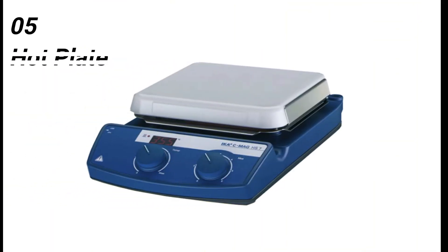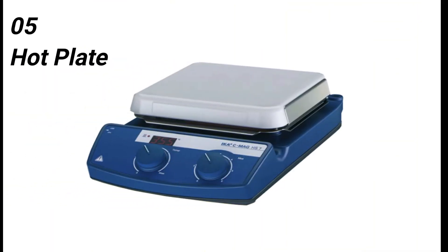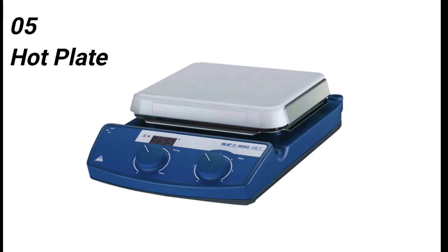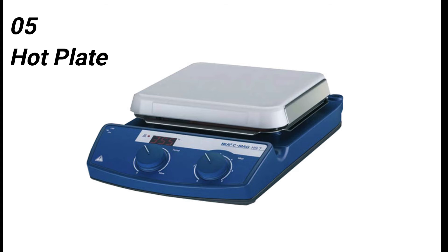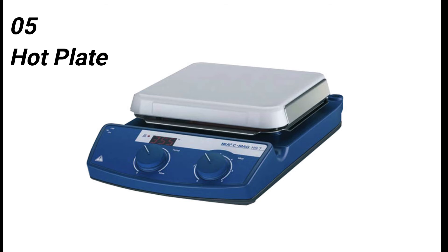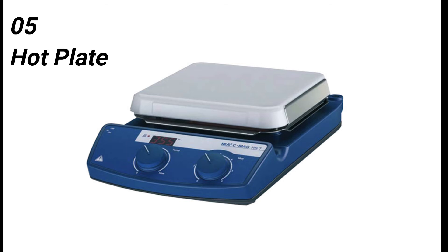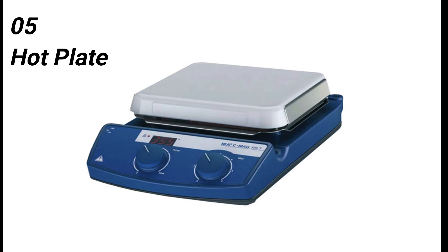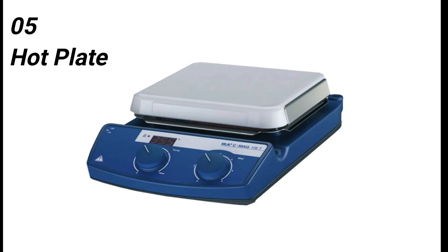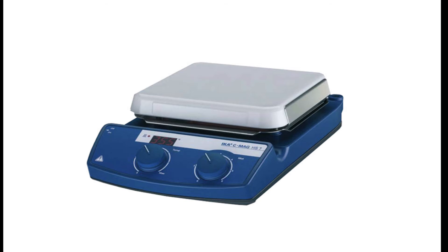On number 5, I would like to tell you about a hot plate. A hot plate is a standalone appliance used in microbiology laboratories as a tabletop heating system. In a laboratory, hot plates are used to heat glassware and their components. They are used over water baths as water baths might be hazardous in case of any spills or overheat.